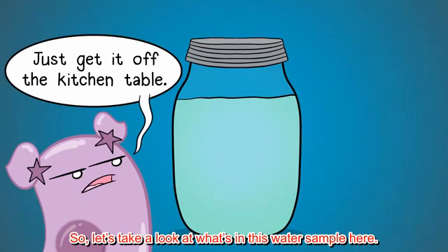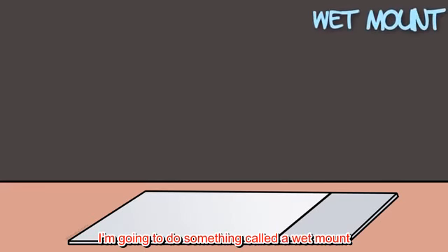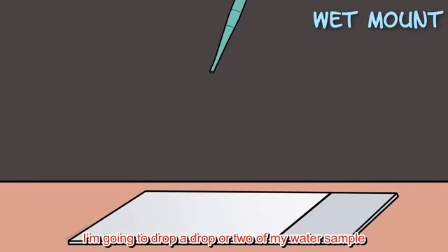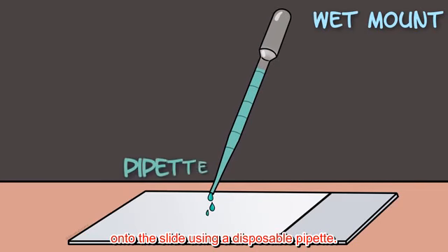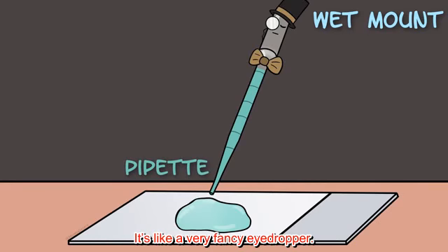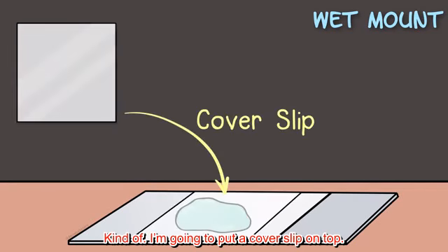So let's take a look at what's in this water sample here. I'm going to do something called a wet mount to prepare my microscope slide. I'm going to drop a drop or two of my water sample onto the slide using a disposable pipette. It's like a very fancy eyedropper, kind of. I'm going to put a cover slip on top. There's some techniques to doing a wet mount to avoid air bubbles that you can check out online.